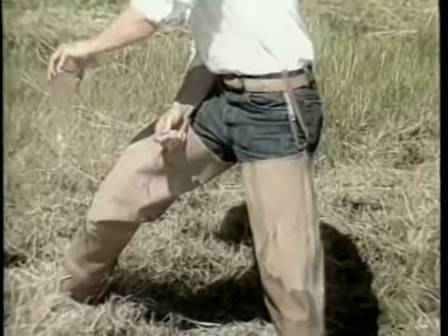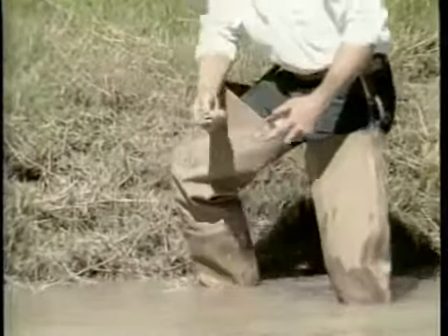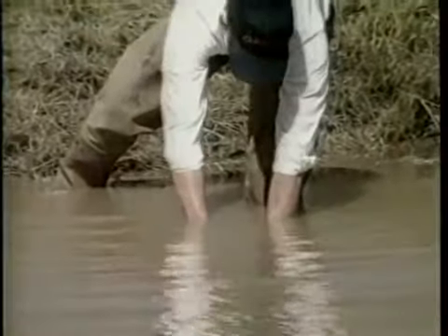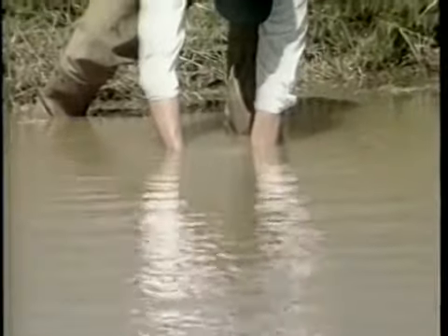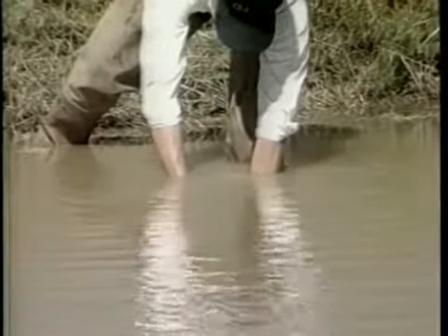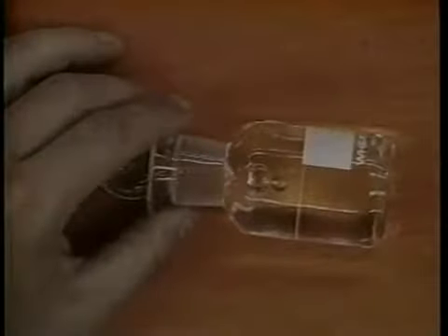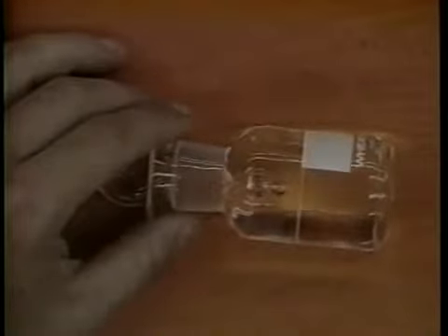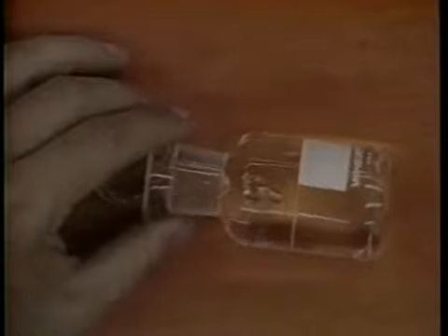Sample away from aerators and inflowing water, and preferably with the wind at your back. This will usually give you the lowest reading in the pond. To take the sample, submerge the bottle approximately 1 foot below the surface. Remove the stopper to collect the sample, and then re-stopper the bottle under the water to ensure that no air bubbles are trapped. It is important that no air bubbles are present, since they will increase the dissolved oxygen value by dispersing the oxygen from the trapped bubbles into the water sample.